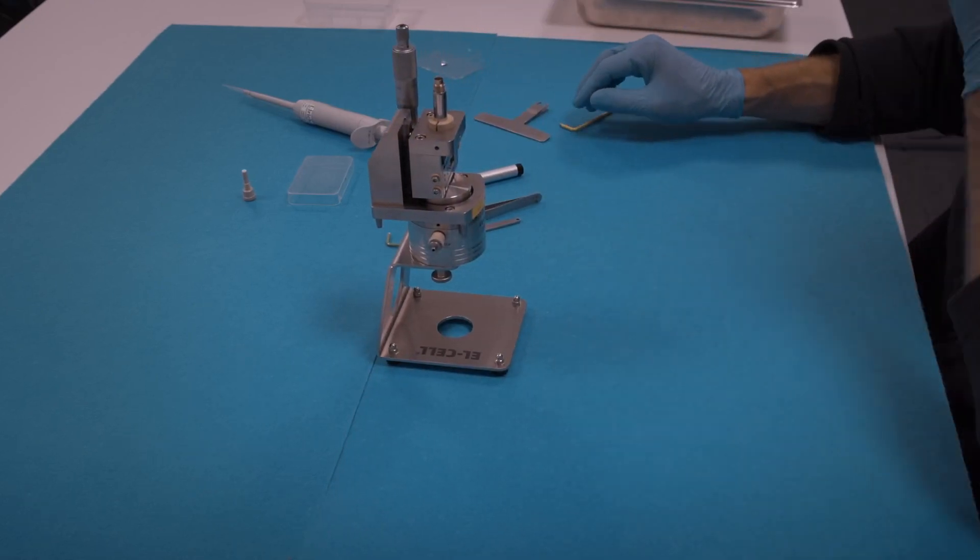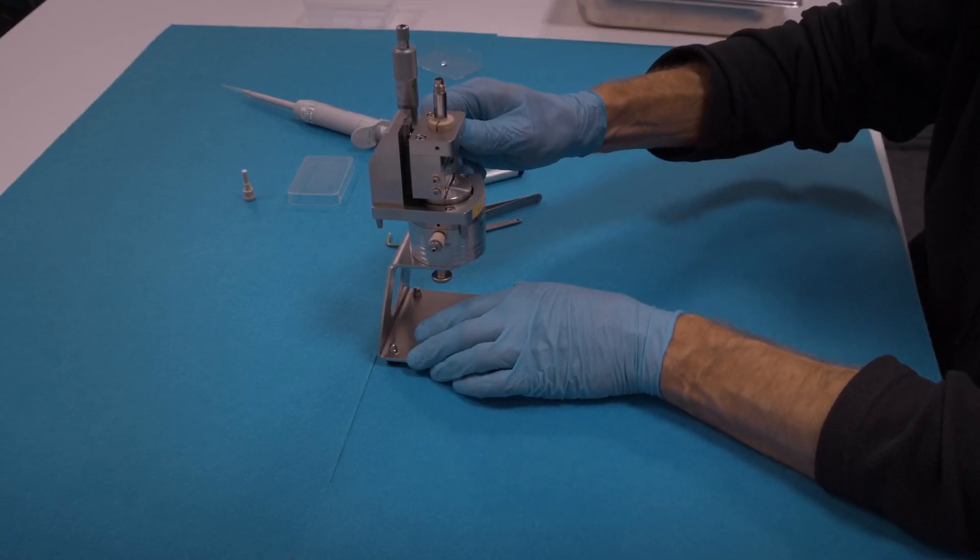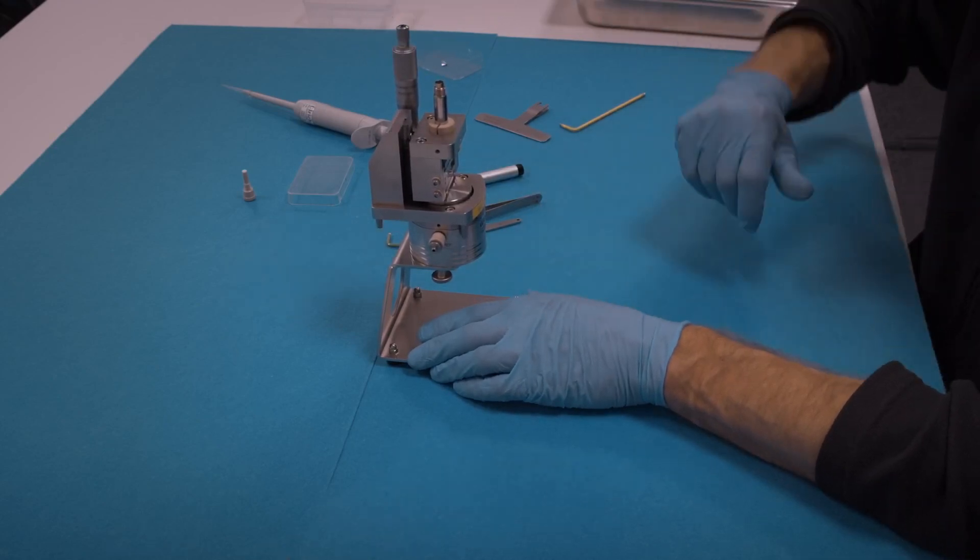Before starting the measurement, of course you have to bring down the sensor so that the tip is seated on the metal membrane. Okay, and done.